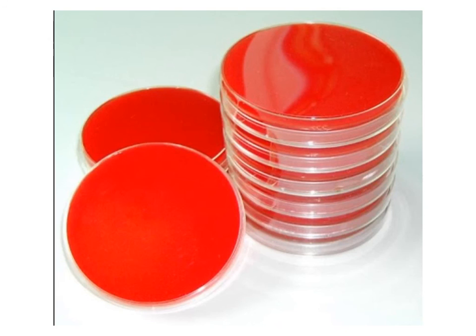The only other thing I would want to tell you is that it's very important on the bottom part of the plate, the part that has the agar, to put key information. You want to put it towards the edge so you can see the growth on your plate, but you want to put the date, what the bacteria is that's growing on the plate, and your group name across the side.